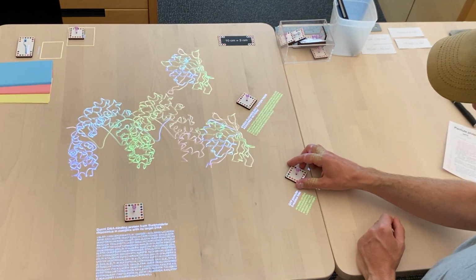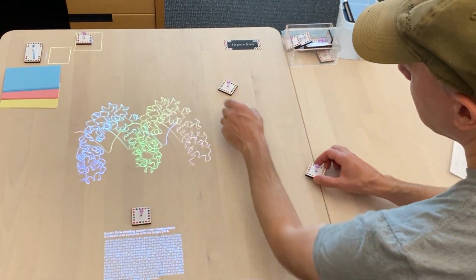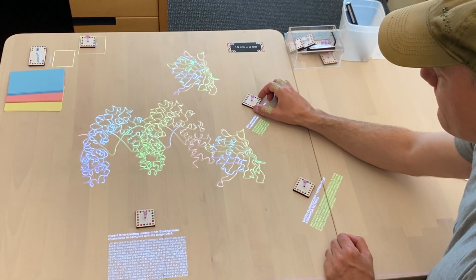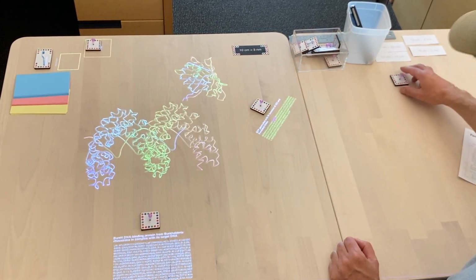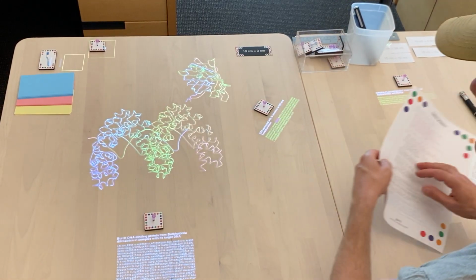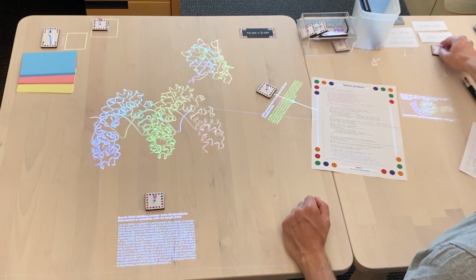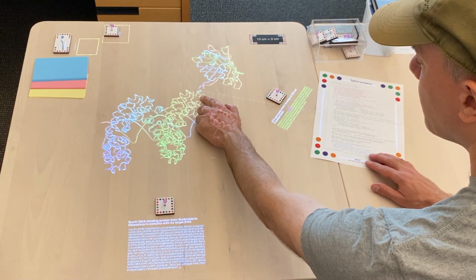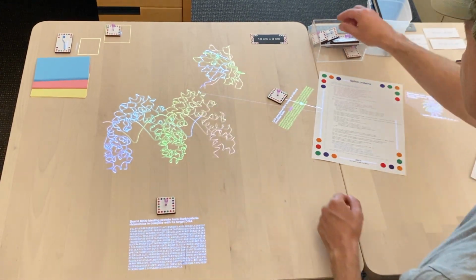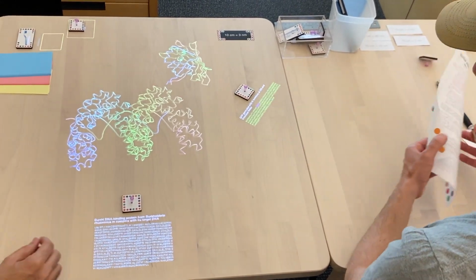So now I'm just comparing them, the new one and the old one, and I'm going to swap our new one into the scene. And next, here's our splice program. I'm going to point its whisker to the spot on BurH where we want to splice in the GFP. And I'm going to pick up the protein representing the two of them spliced together.